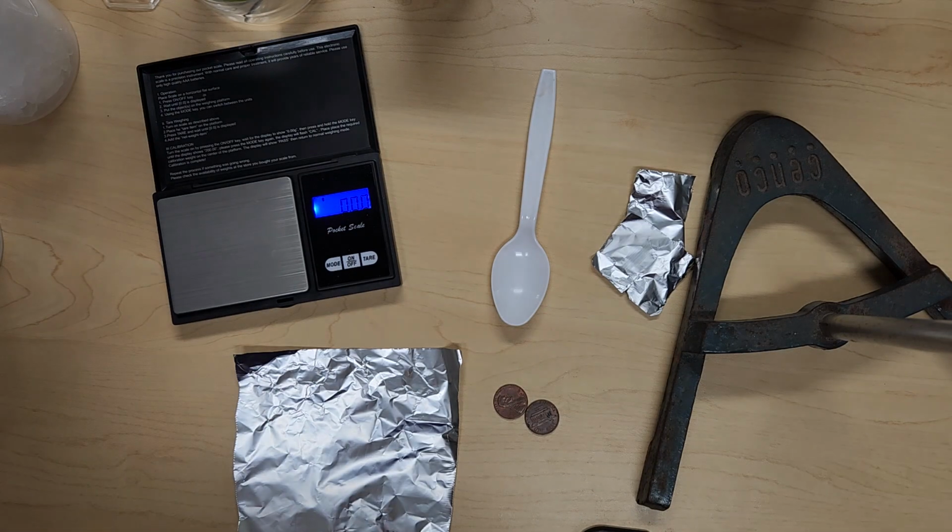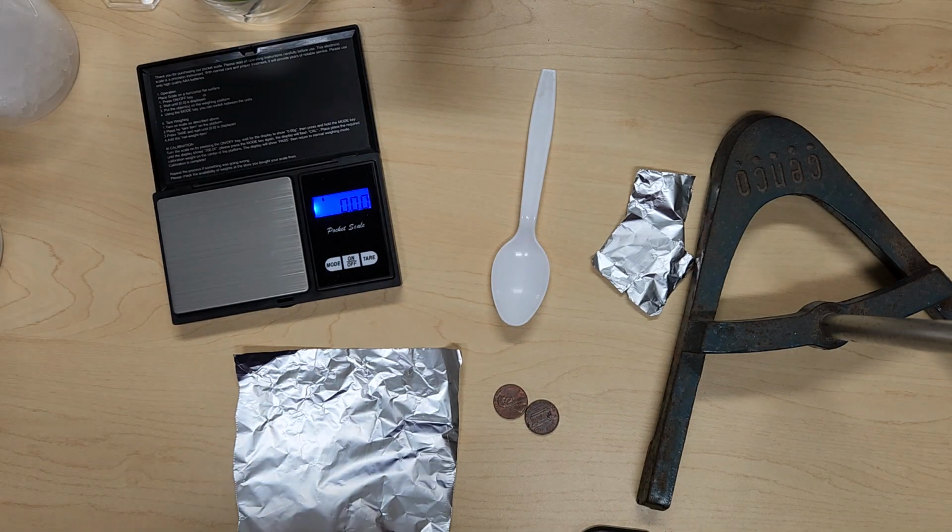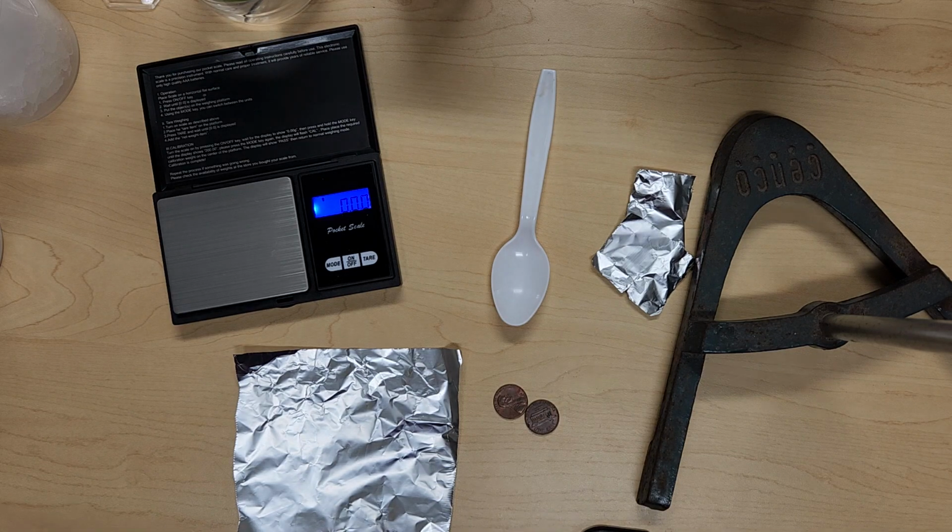If you are pouring something into the graduated cylinder and you're going to change materials, make sure that you rinse it out well with water a few times so that, say if there's vinegar in there, it's not present for the next part of the experiment, because vinegar may change your results if there's a little leftover vinegar present. Okay, so contamination is going to be something to think about. So rinse any of your materials as we go through.